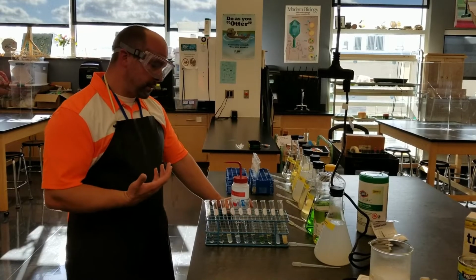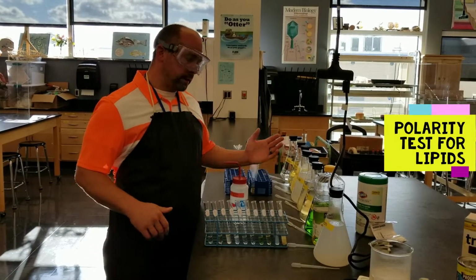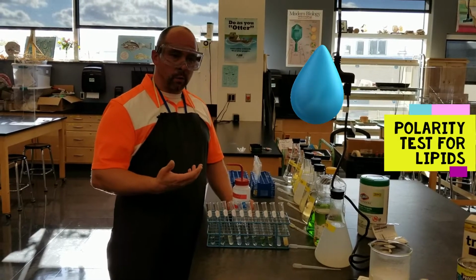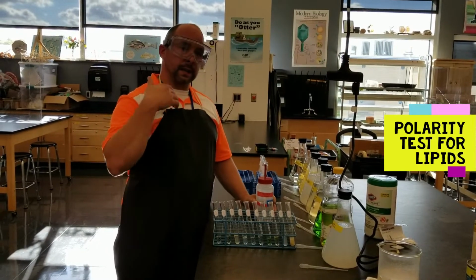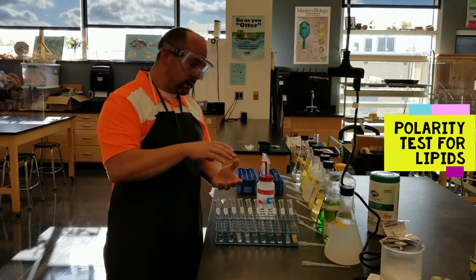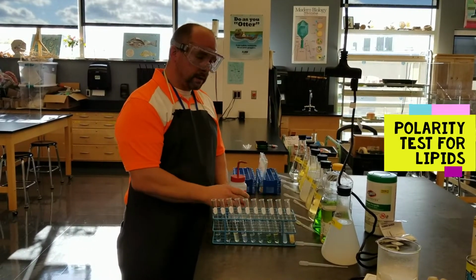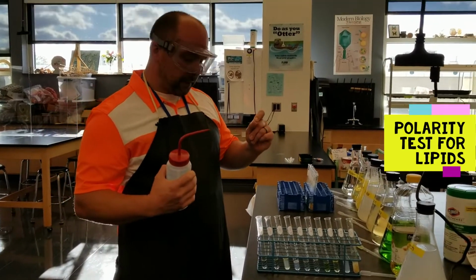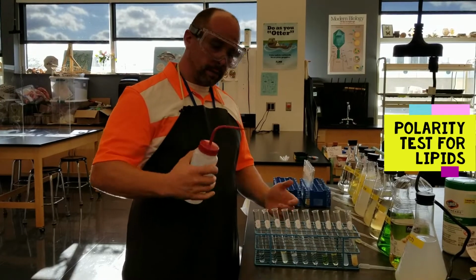All right, so part 2 of our test for lipids includes testing the polarity of our solutions. A food that is soluble in water will easily mix when I add water to it. However, if it's a lipid or a fat, it is not going to be soluble in water, and it will actually create its own separate layer above the water. So that's one easy way to test. And so I'm simply going to add about a finger's length of water to these test tubes and see if a second layer forms above the water.